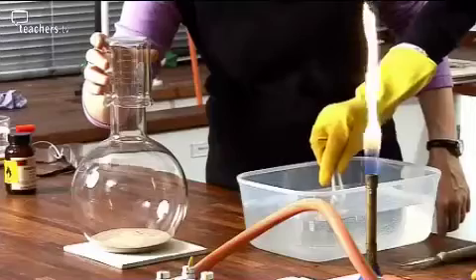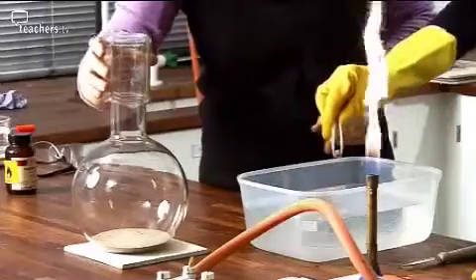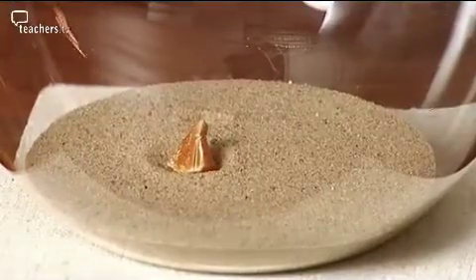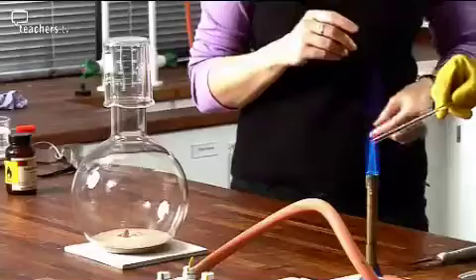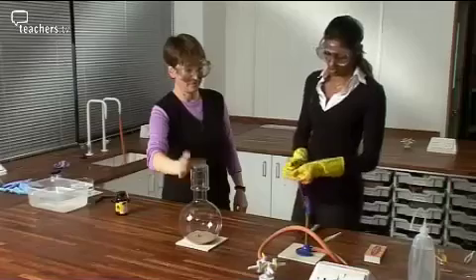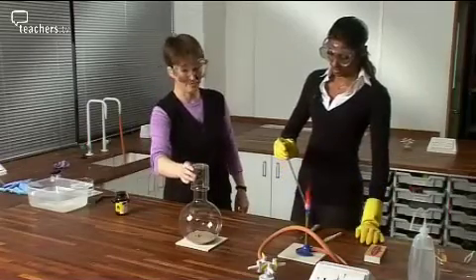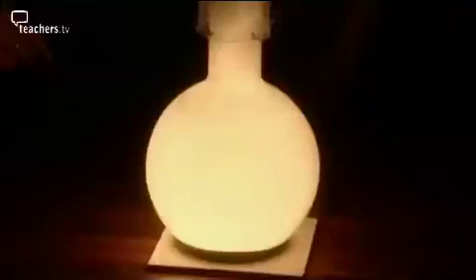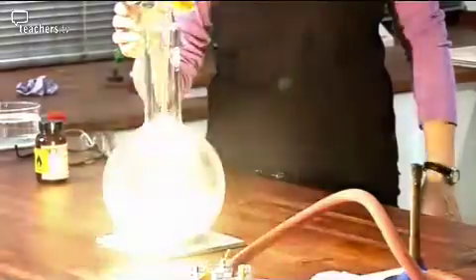Oh, well done. Brilliant. The reaction takes place in a flask which contains air enriched with oxygen. I'm using a heated glass rod to kick the reaction off. All right, and just go vertically in and then lift the glass rod straight out. Wow. And there's the clouds of phosphorus pentoxide. It's quite a violent reaction. I did put a little bit of oxygen in there out of the cylinder, but mostly it was air. But that's the phosphorus reacting with the oxygen. Wow, fantastic.